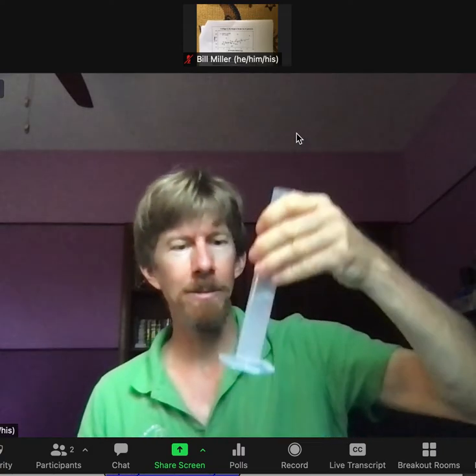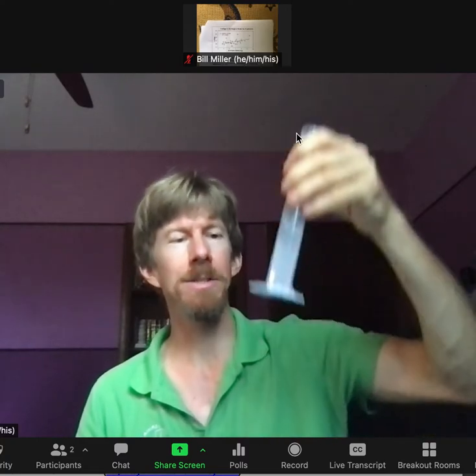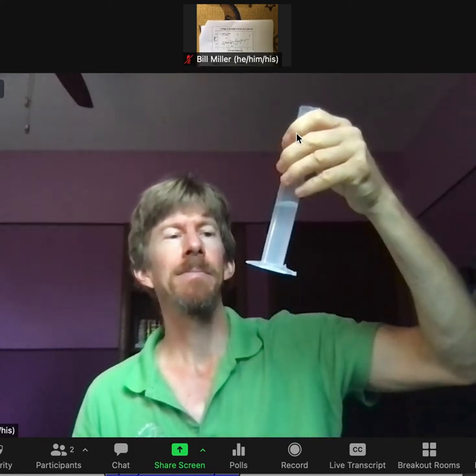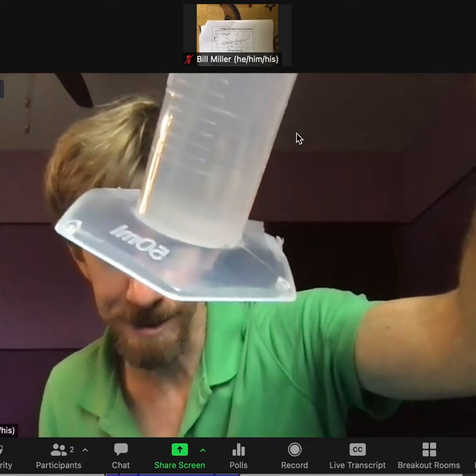With 25 milliliters in there it's actually pretty tough to spill while swirling. I can see swirlies — those are density gradients, because the sodium chloride solution is more dense than pure water. The sodium and chloride ions fit between water molecules, taking up similar volume but adding mass, so more mass for essentially the same volume means higher density. Almost done — no solids left in the bottom.